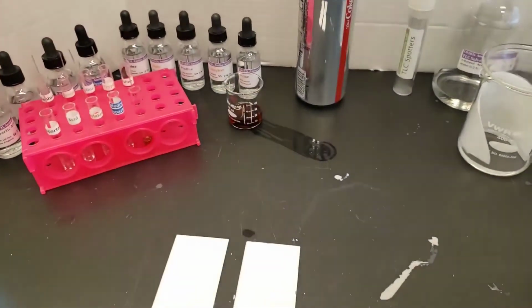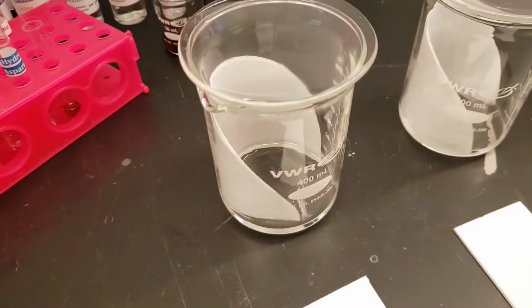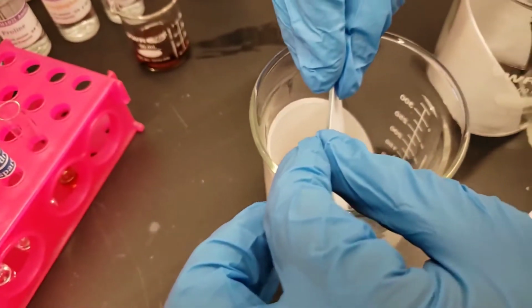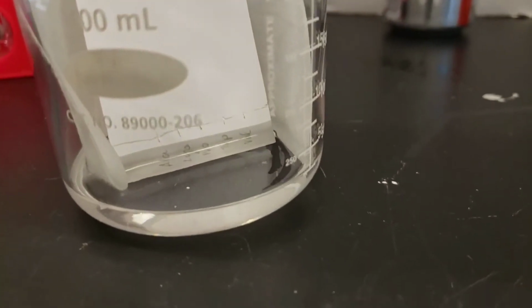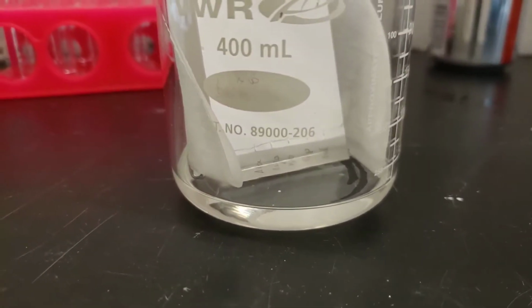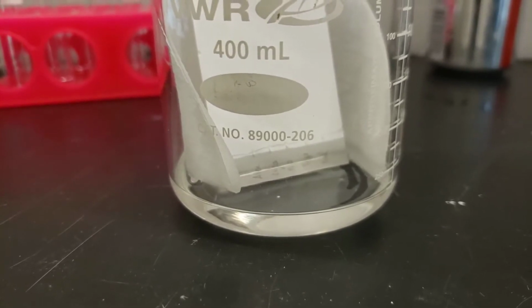Once we're ready to put the plates in the chamber, we'll take the watch glasses off the top and just very carefully set it in. We don't want it touching the sides of anything. Get that lid back on, and here you can see the solvent just creeping up the plate. It only takes a few seconds to get up to that line where our spots are. After that, it's going to begin carrying them up the plate. This is all shown at regular film speed so that you can see how fast it goes at the beginning.